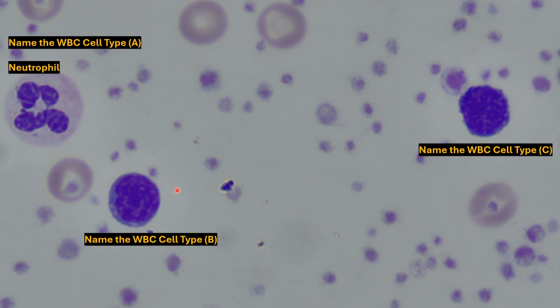Now, the next two might appear very similar, and they are. If you see this one here, the nucleus goes from there to there, and we can see a little bit of cytoplasm over here. Compared to the one over here on the right, there's not much cytoplasm we can see. You can see there's granules all over that, but you can really see more of a distinct nucleus here on the one on the left compared to the one on the right. That's because the one on the left is a lymphocyte. We can see the cytoplasm here. And the basophil over here on the right, that nucleus, it's really hard to distinguish. It's kind of this S-shaped thing, but we can't see it because there are a lot of granules superimposed over that. So that is our basophil.